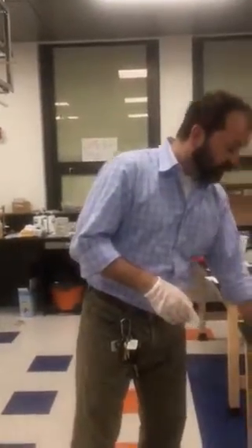So presumptive blood test means that it doesn't tell us what type of blood it is, but it'll tell us if the stain is blood based on the hemoglobin in the blood, or if it's not blood, say it's ketchup, barbecue sauce, something else, red paint.